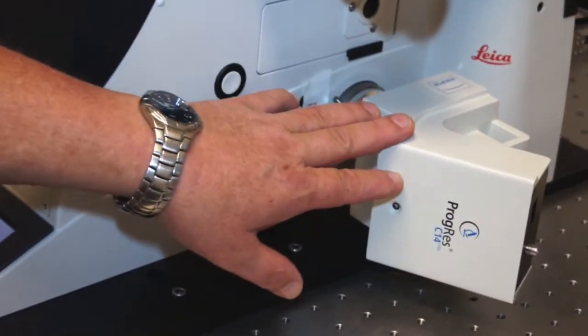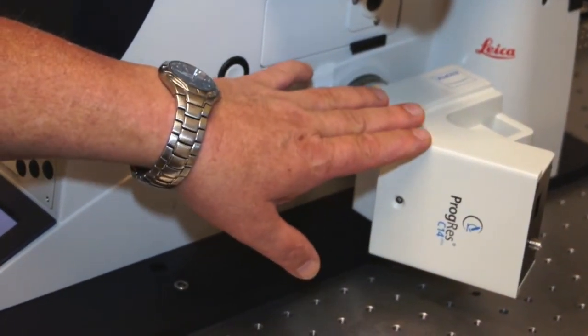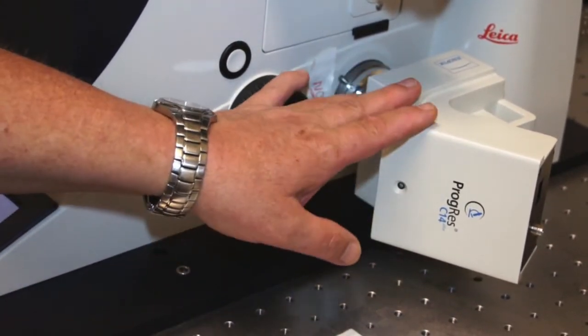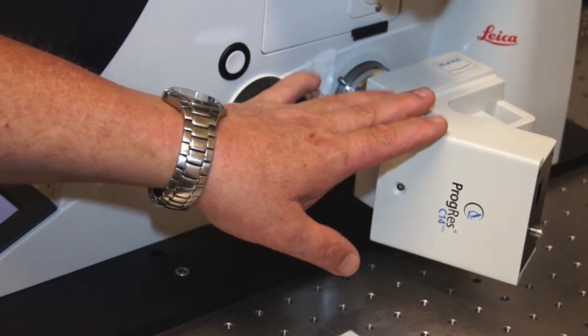As mentioned previously, we have an attachment digital camera hooked onto the camera port of the microscope. So we can take pictures right off the microscope if that's your desire.